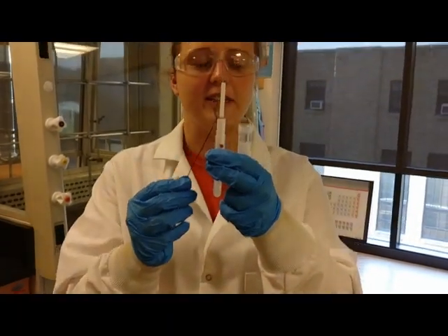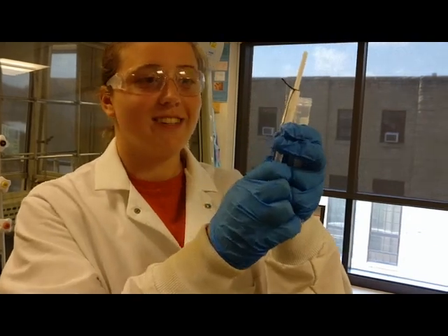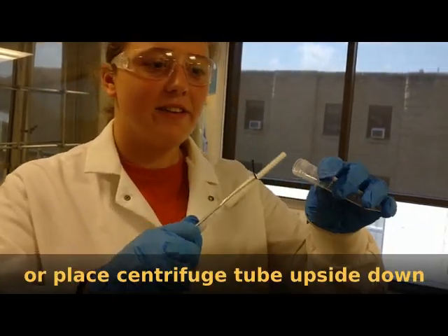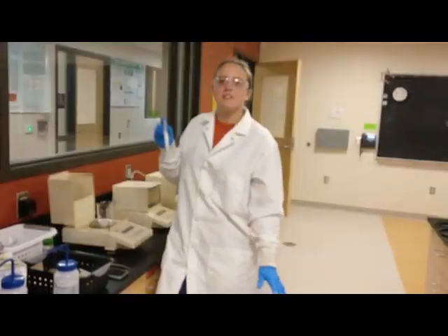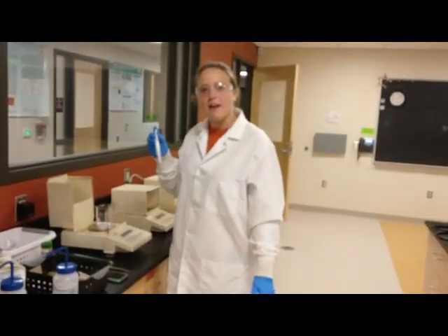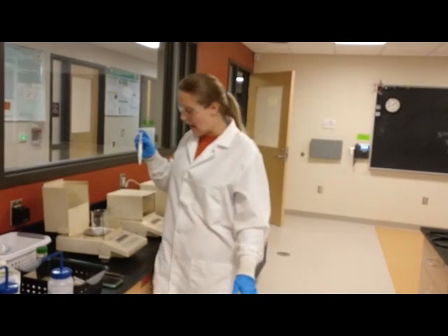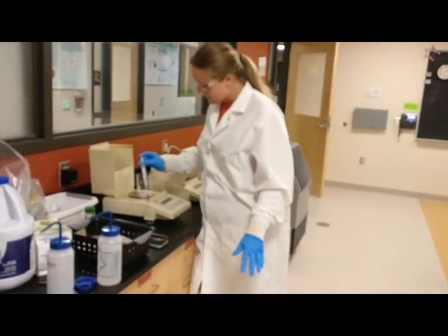Okay, so to transfer a Craig tube into our centrifuge tube, you're going to pull down on this string so it's nice and tight. Then you're going to flip it over, and we're ready to go. You can actually centrifuge your solution. You have to make sure the centrifuge is balanced. So to do that, you're going to weigh your Craig tube.